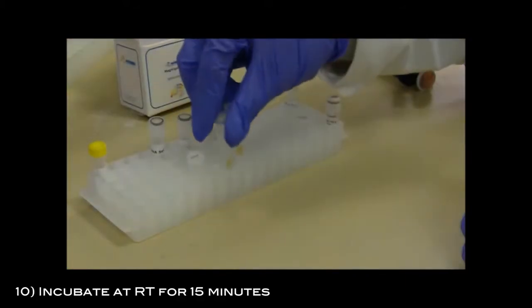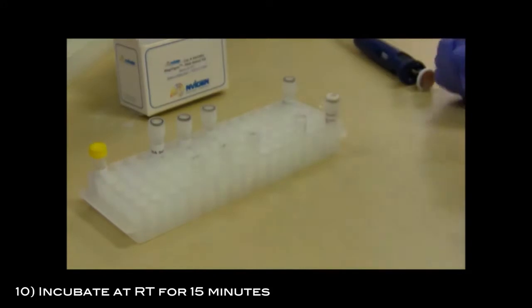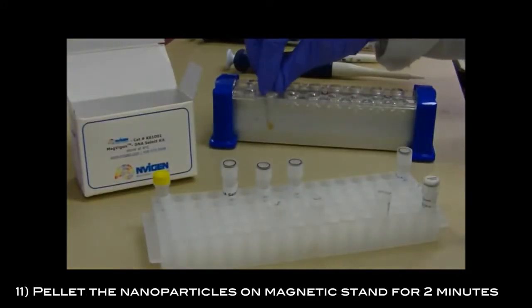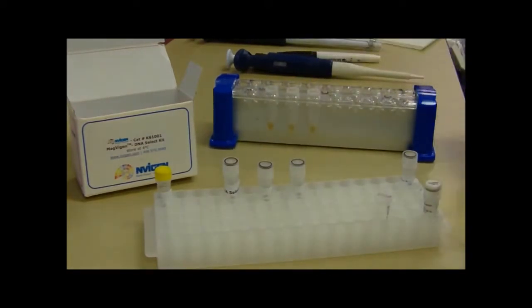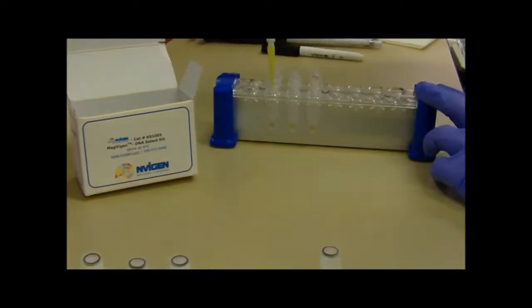Incubate at room temperature for 15 minutes. Pellet the nanoparticles on the magnetic stand for 2 minutes. Then remove the supernatant.